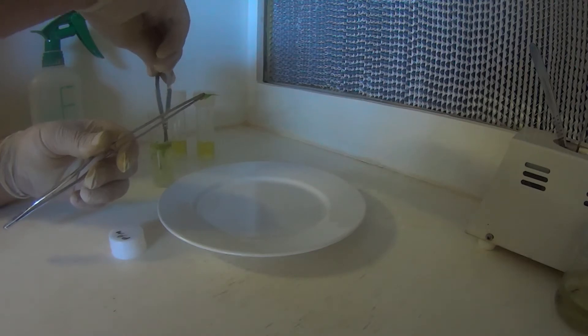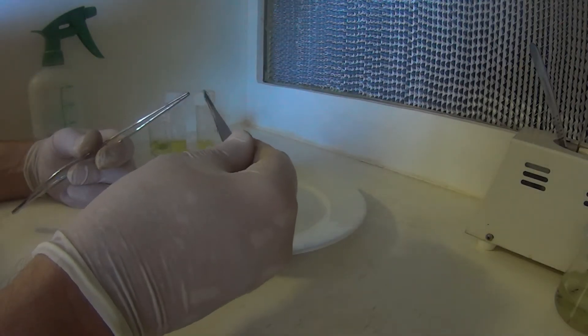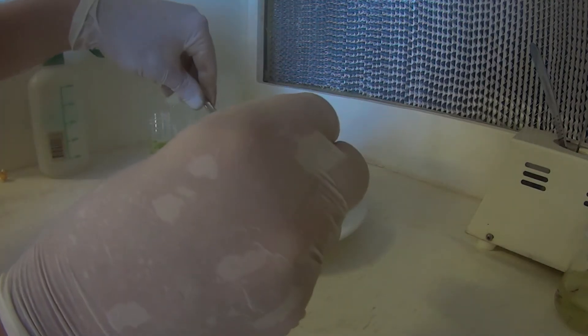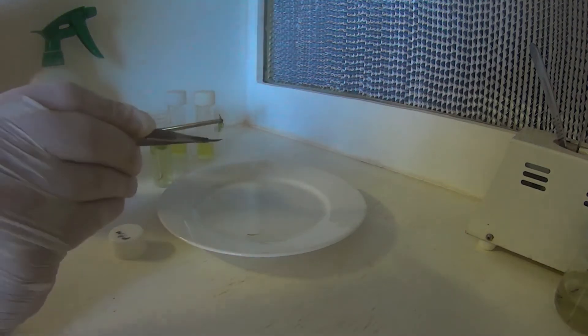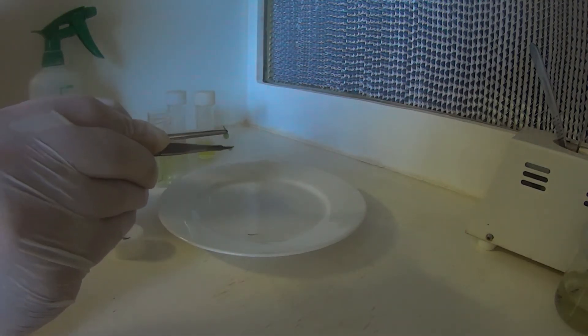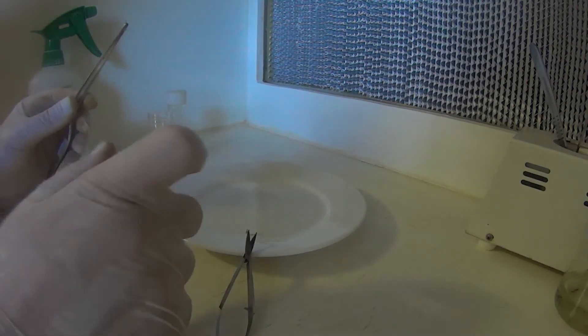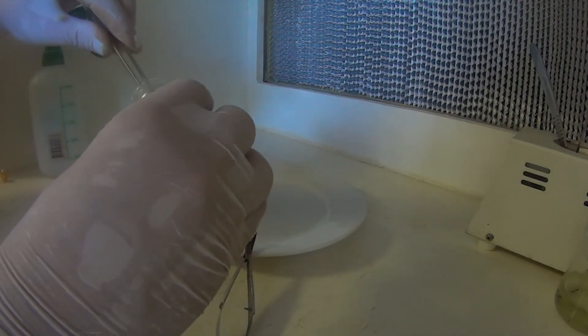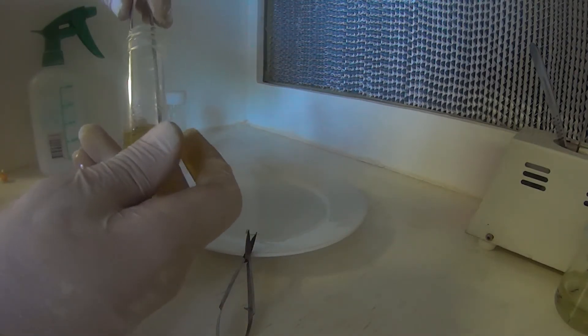Scissors out. A little bit cool, a bit hot. Snip off the end like we did for the bleach. Away from me. And also remove the trap from the other end. And then, it's just a simple matter of placing the piece onto the media.